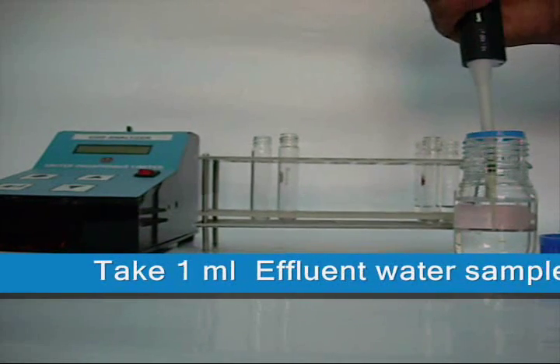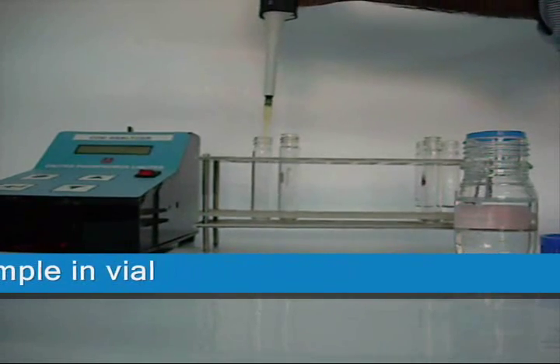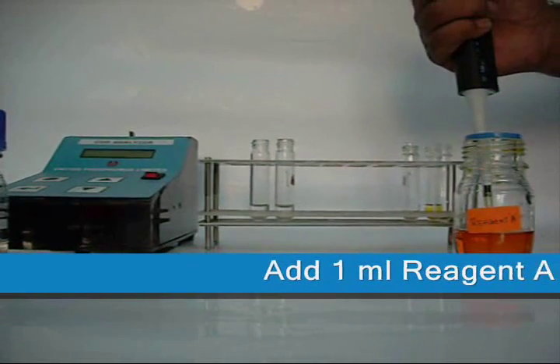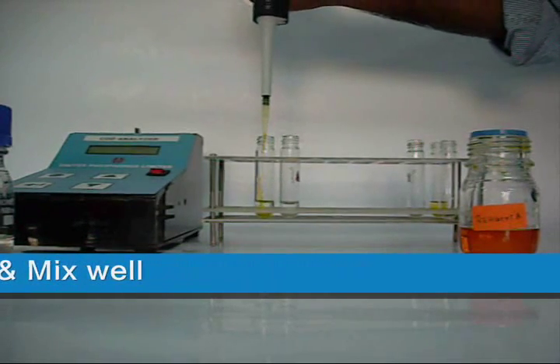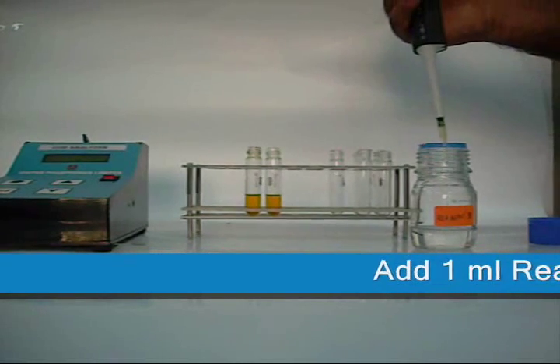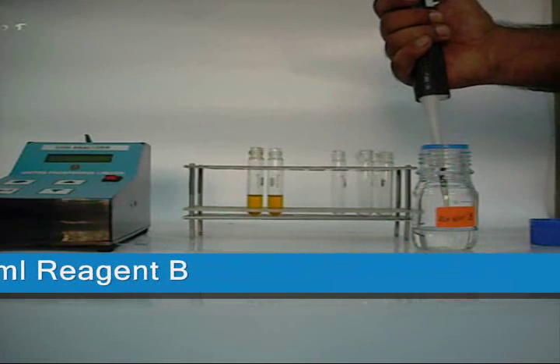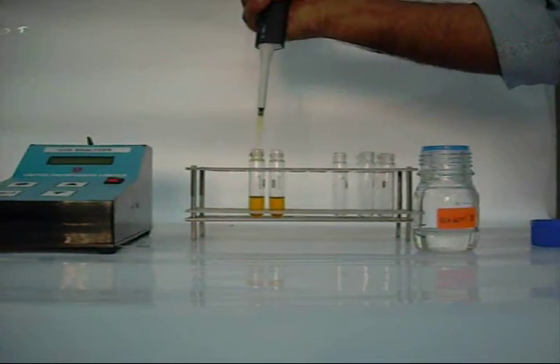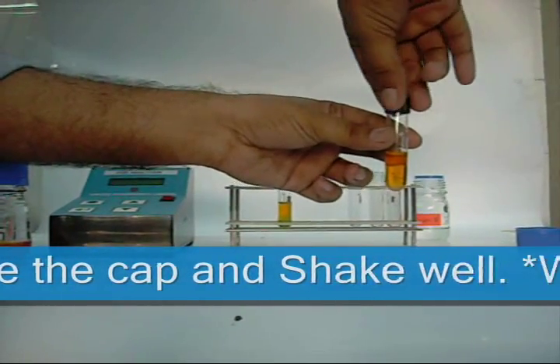Take 1 ml of effluent water sample in a vial. Add 1 ml of Reagent A and mix well. Add 1 ml of Reagent B. Close the cap and shake well.